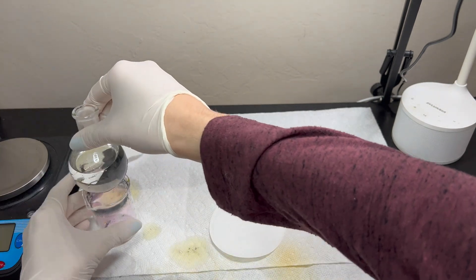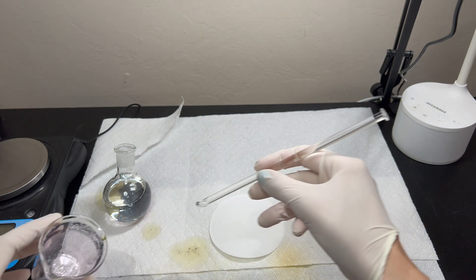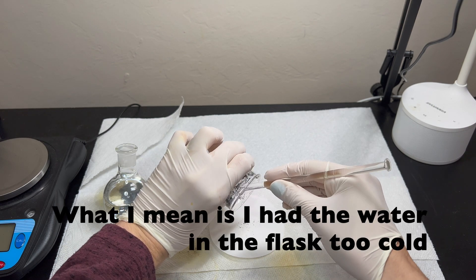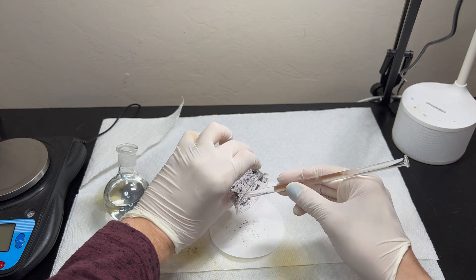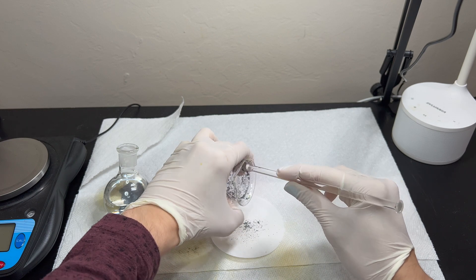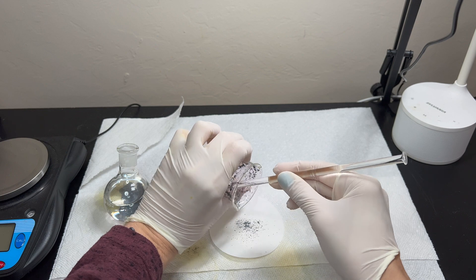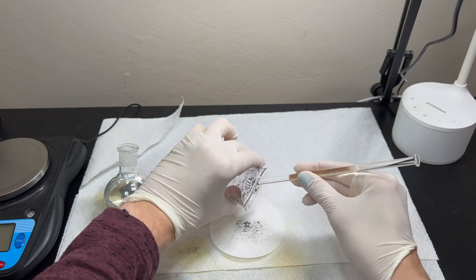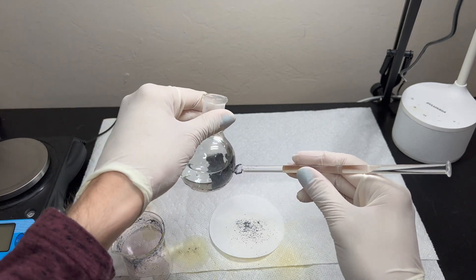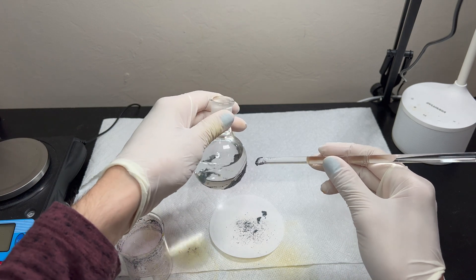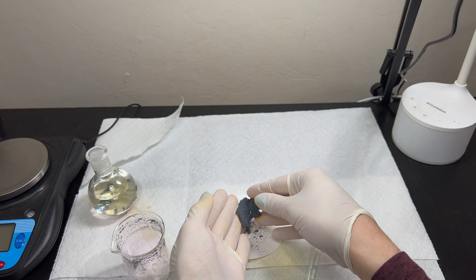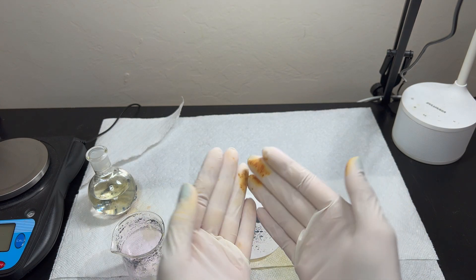Once the iodine is completely cooled and dried off now, you can start to scrape what's left of the iodine on the beaker out onto the filter paper. So, that's still a little bit wet because I didn't do it properly. But, if you take the iodine, just scrape it off the beaker, you can see that you have nice crystals. Again, make sure to wear gloves with this, because if you don't, you'll be having a very bad day. Once you're satisfied with what you've got, you can also get some of this off the end of the beaker as well. You can see a big chunk came off right there. So, that's pure iodine. So, as you can see, it's already stained my gloves. If you weren't wearing gloves, like I said, bad day.